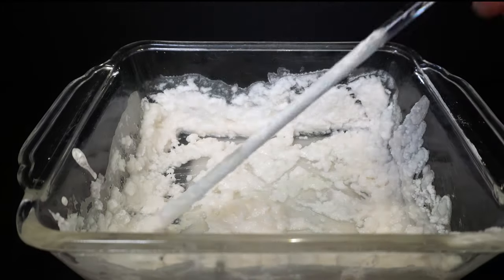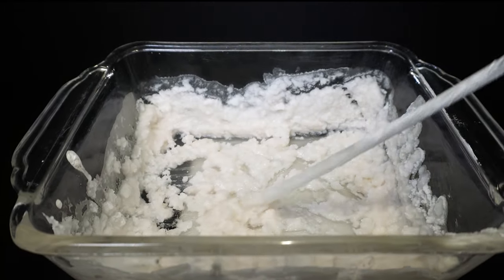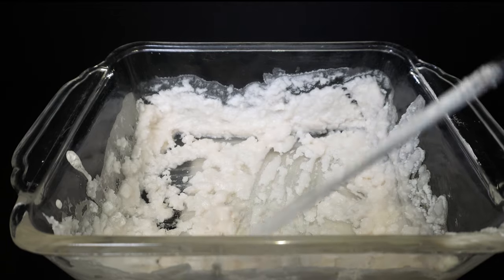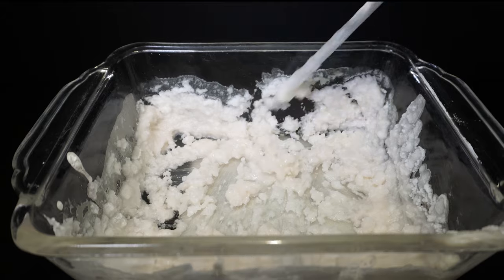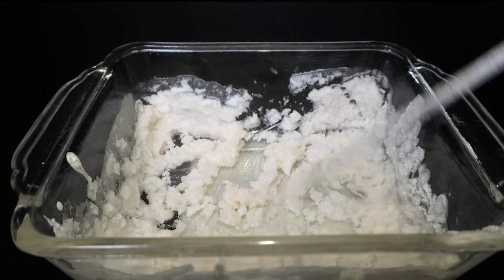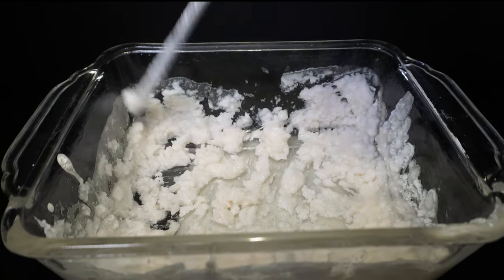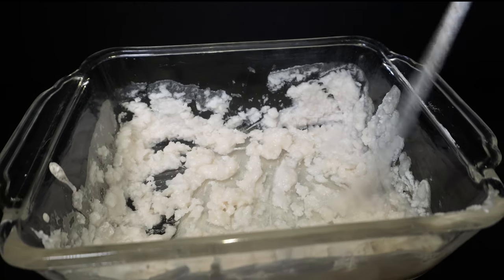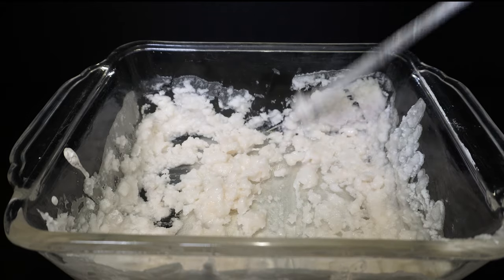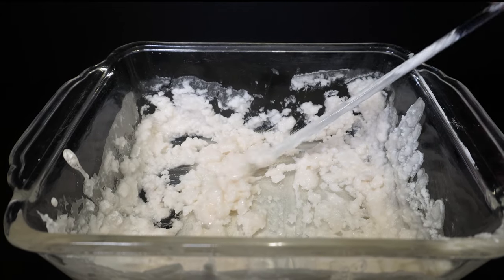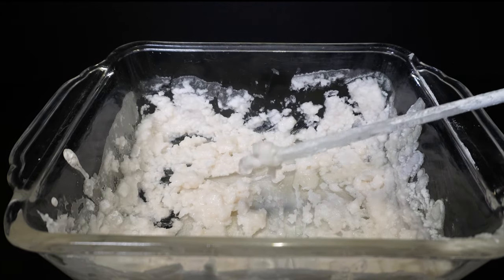After that you will have a nice white calcium acetate. This is nowhere near pure calcium acetate though. We would have to re-dissolve everything again, filter it, and boil it off further. Though for my next few projects I won't need super pure calcium acetate, so this will work just fine. In the future I also plan to work with other acetates like sodium acetate to re-form crystals.